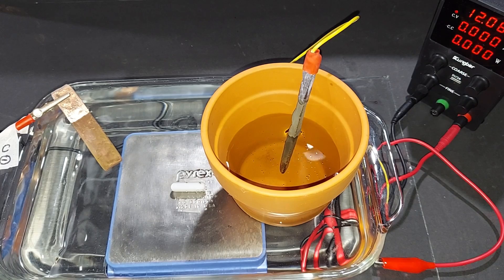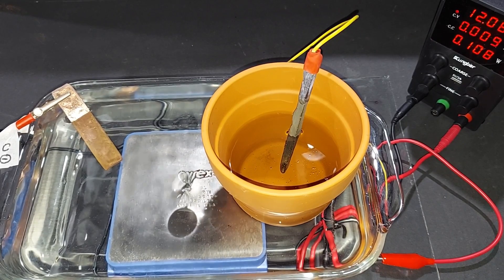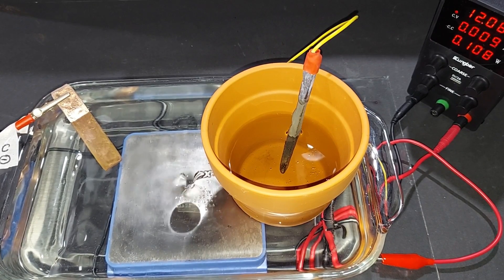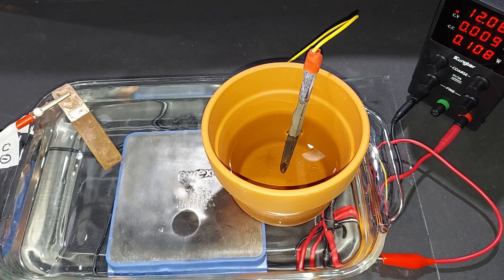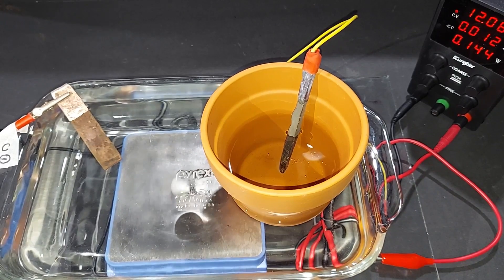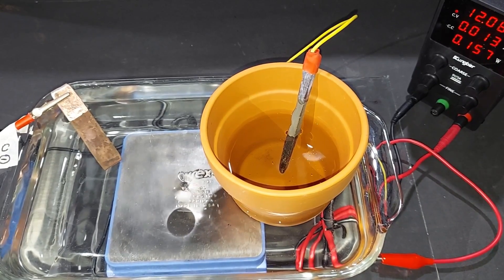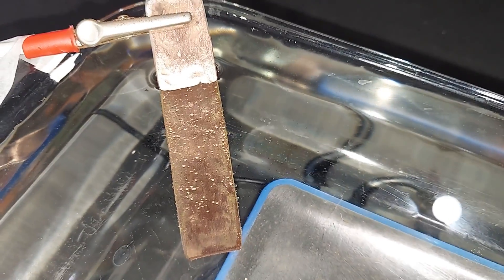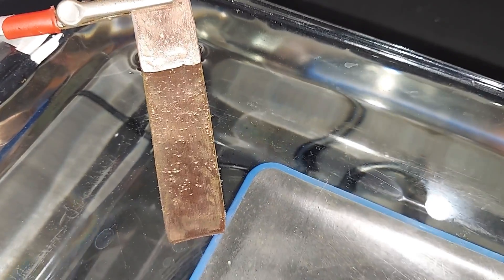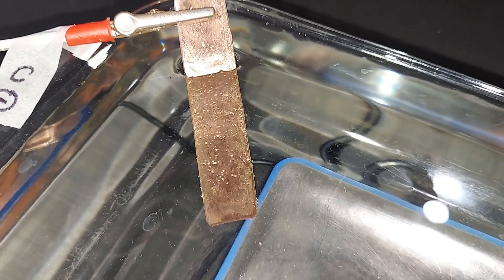We just started pulling a pretty low amperage: 0.009 amps. Those sulfate ions have just crossed the clay pot. The amps are slowly creeping up—now at 0.012 after about 35 minutes. We'll know ions are really transferring well when we see hydrogen bubbles form at the cathode. We're at 0.27 amps now, and you can see hydrogen bubbles starting to come off that copper strip. The hydroxide is also coming to this side, making magnesium hydroxide.